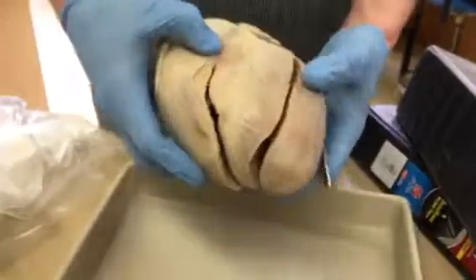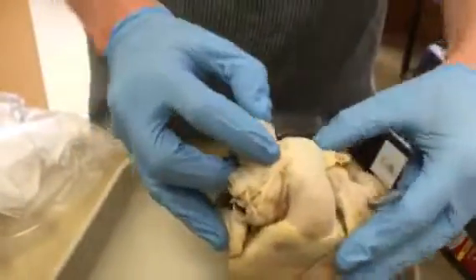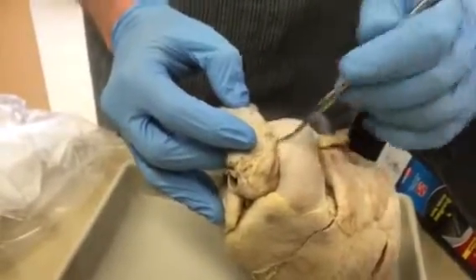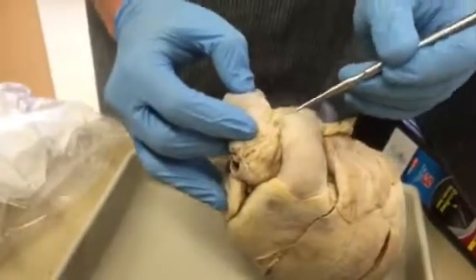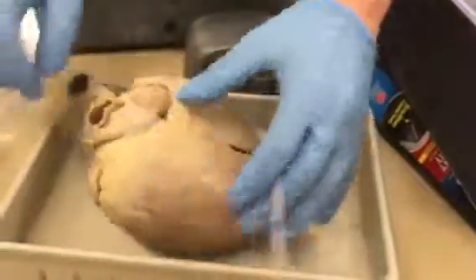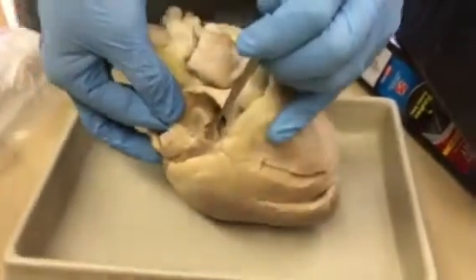Then the other structures, the ligamentum arteriosum is this bit of tissue that's holding the aorta and the pulmonary trunk together. Okay. So you're going to see that. And sometimes it's a little smaller than this. It used to be a vessel during fetal circulation, and now it's turned into a little thing that holds these 2 things together. The fossa ovalis is this oval looking window right there.